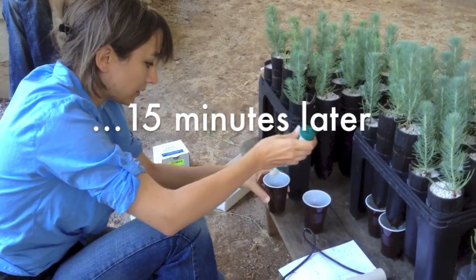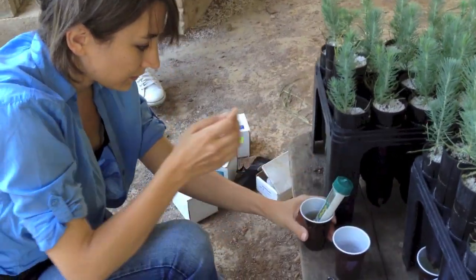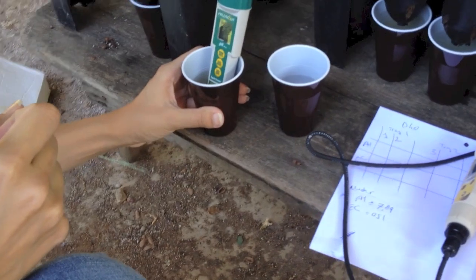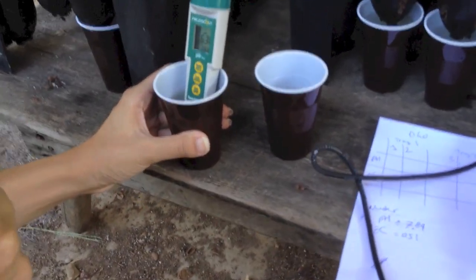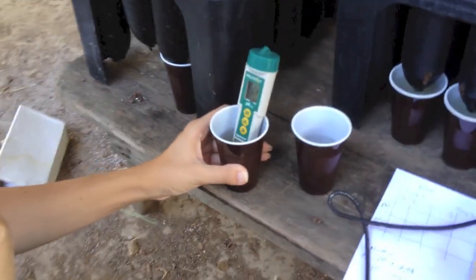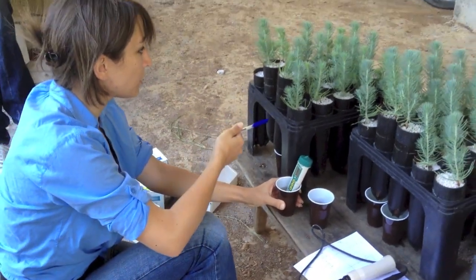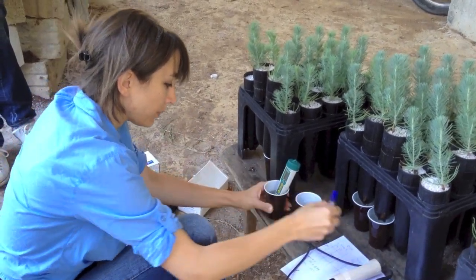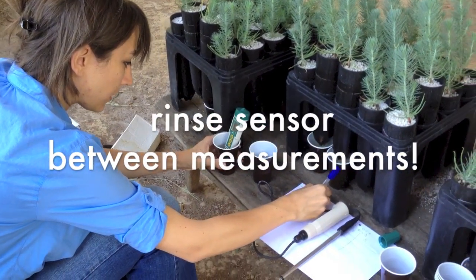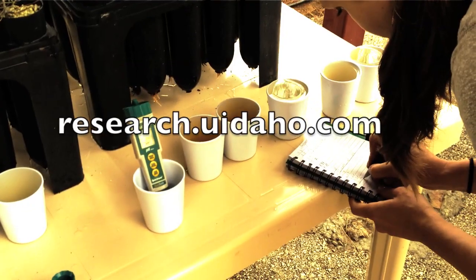After 15 minutes have passed, place the end of the sensor in the leachate. In this demonstration, the manager is using a pH meter; however, the same principles apply to measuring EC. Allow time for the measurement to stabilize — this could take a few minutes depending on the instrument you are using. When you are finished, record your measurement, then rinse the sensor head with distilled water and repeat with the other containers of leachate.